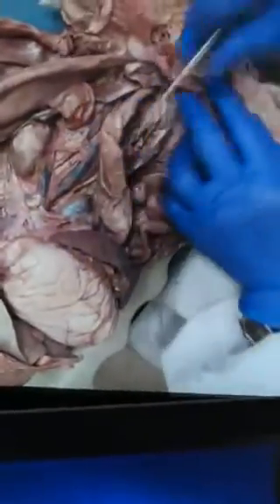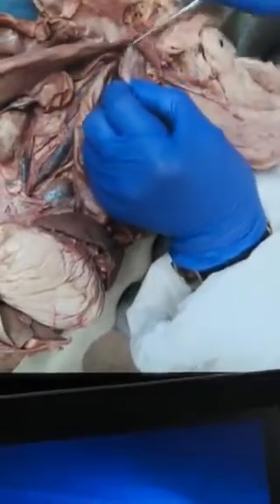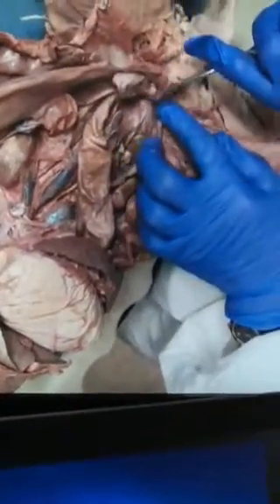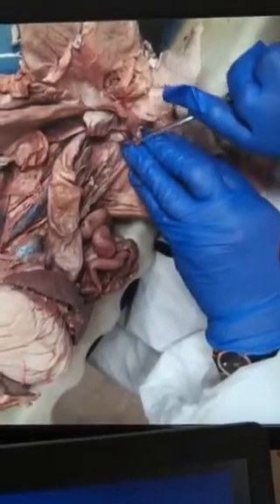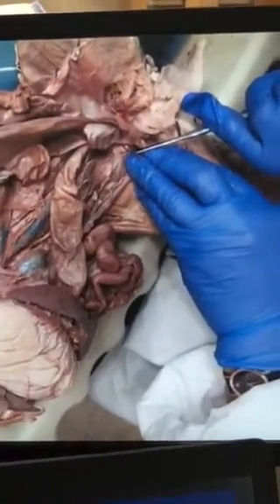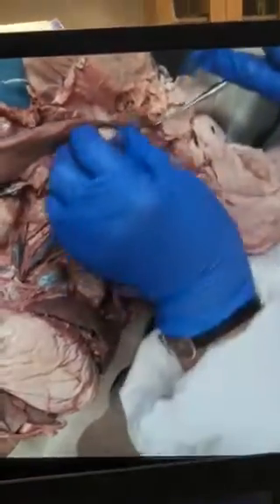Now, if it is a male cat, you don't find the uterus. What you find near the urinary bladder are two white threads that go around — that is called the vas deferens.